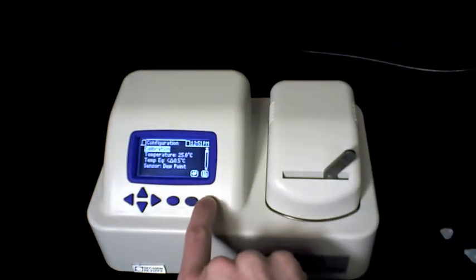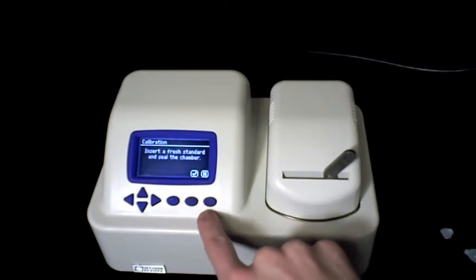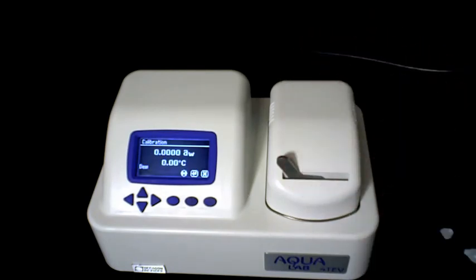Using your Aqualabs menu, select Calibration, and then Start. Turn the lever to Read, and the verification process will begin.